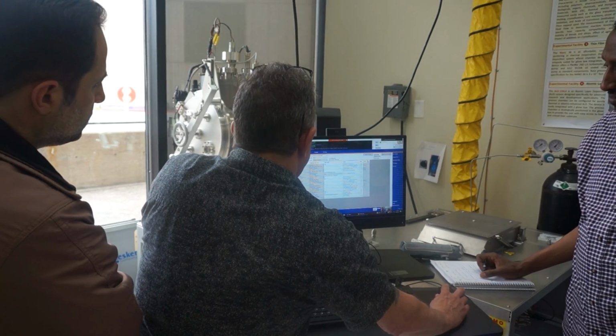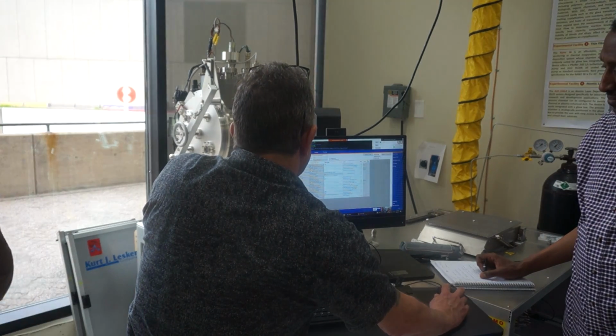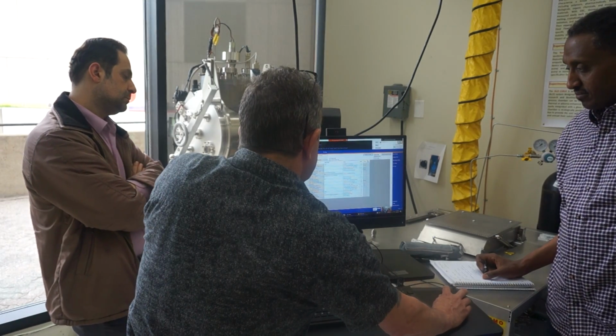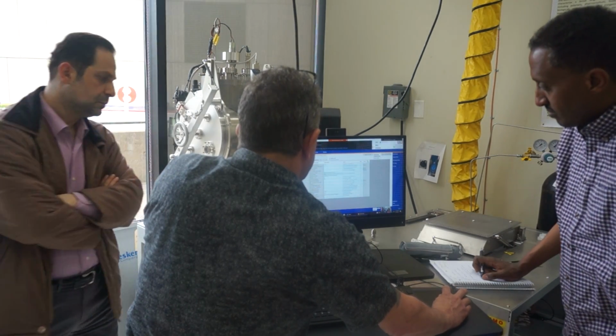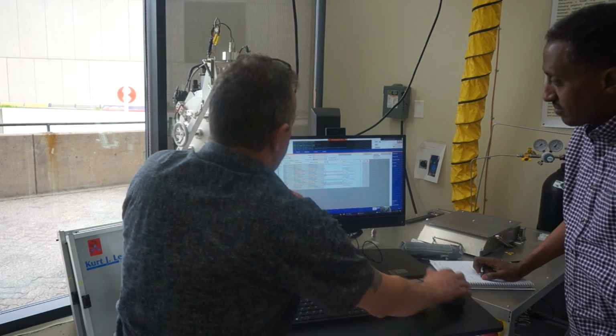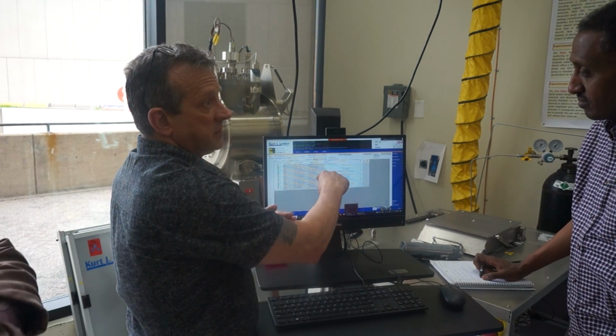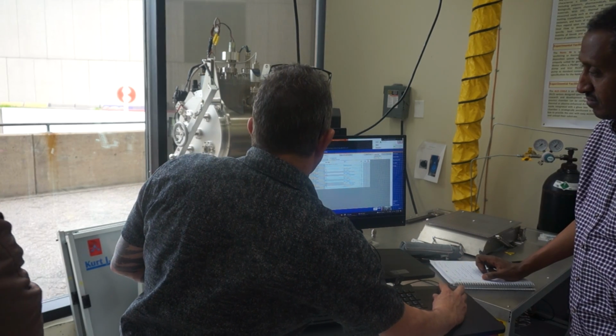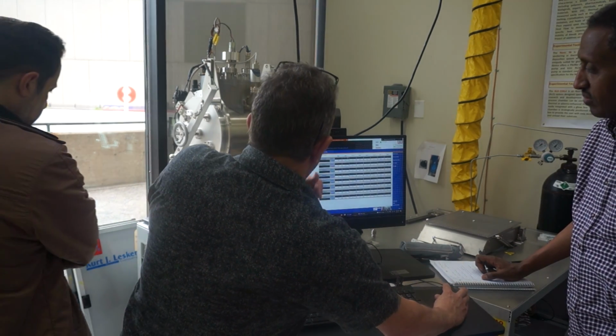There's a dwell step. Step 5 is another sub-recipe. This is what populates the matrix as far as what we've seen in the process. So that'll put all this up here.